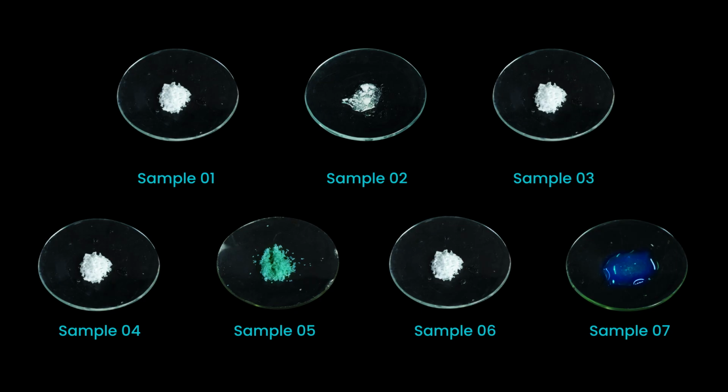demonstration. You can see that 4 solid samples are white, and 1 solid sample is green. The liquid sample is also blue. Salt is either dissolved in water or the solid salt itself is used for the experiments. The salt solution needs to be highly concentrated to produce an intense color in the flame. Therefore, a solid sample is preferred as we can perform the test with a tiny amount of sample.